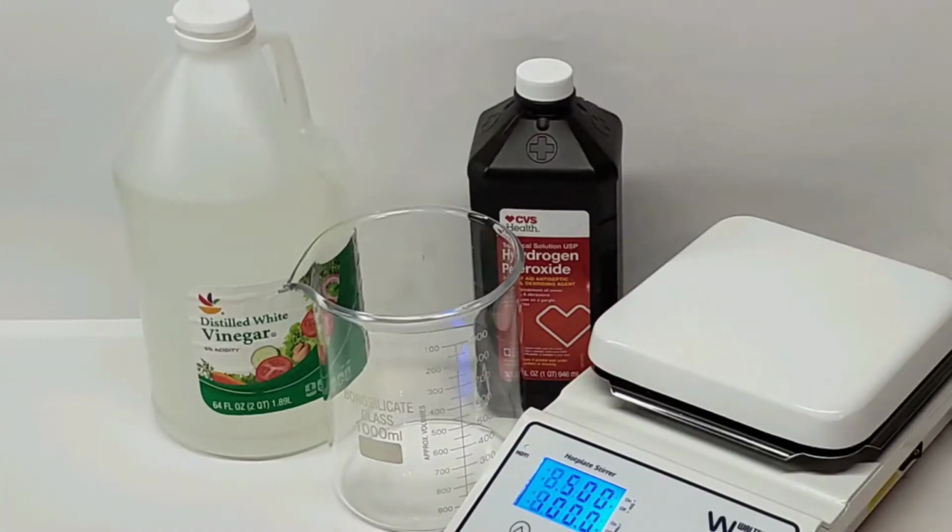And today we're doing some copper chemistry in the form of copper acetate. Now, in terms of making chemicals at home, copper acetate's pretty approachable. All the stuff you need is pretty widely available and it's not going to kill you unless you drink it like a dumbass. So, that's cool.